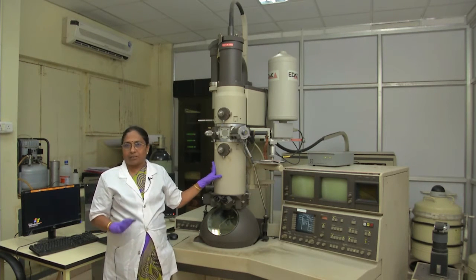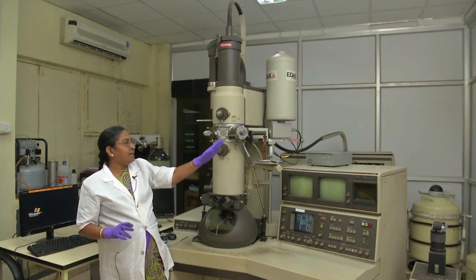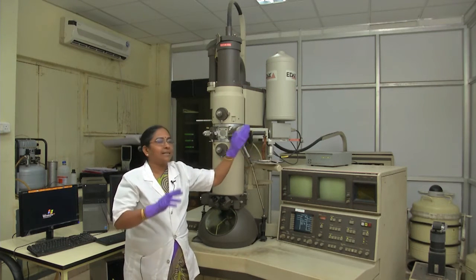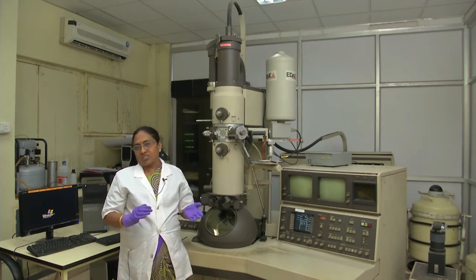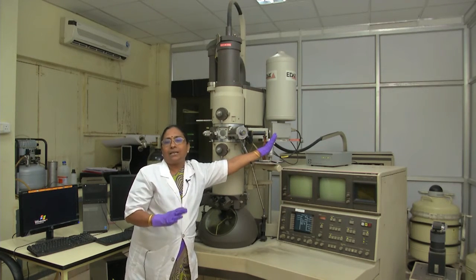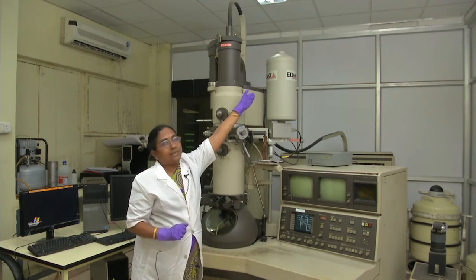By using this transmission electron microscope you can get structural information, crystallographic information, as well as chemical information. The chemical information can be achieved by energy dispersive X-ray analysis. By using characteristic X-ray energy you can detect the elements present. When the electron hits the specimen, X-rays come out; each element has a characteristic X-ray energy that is detected by a silicon-lithium detector. Silicon-lithium is single-crystal silicon doped with lithium. Because lithium is a very light and mobile element, the detector must be cooled to liquid nitrogen temperature.